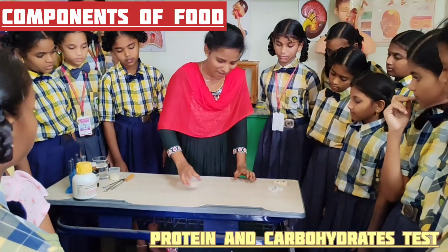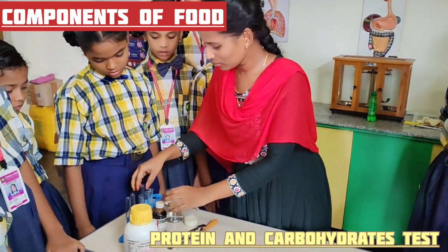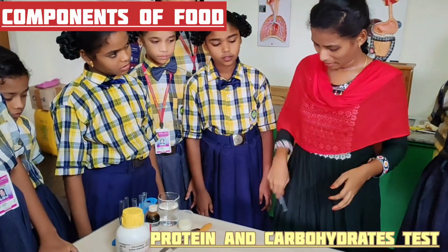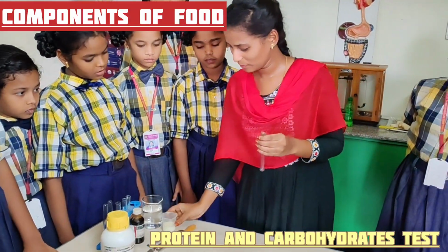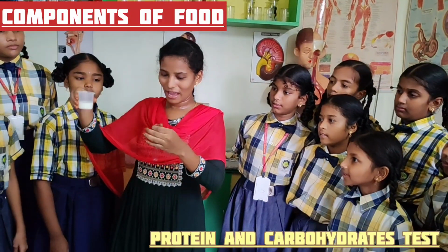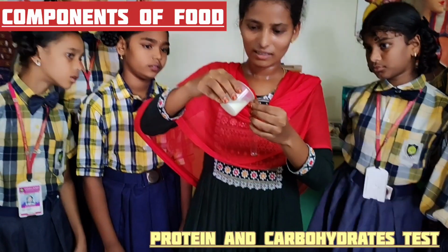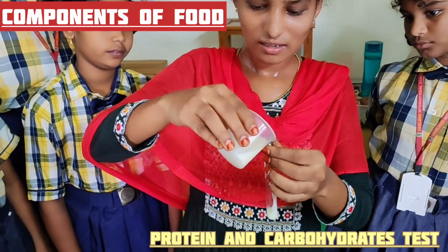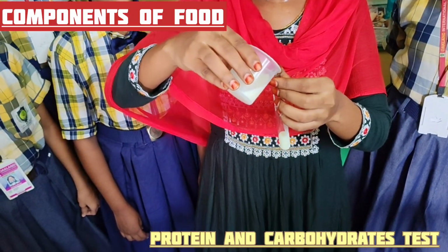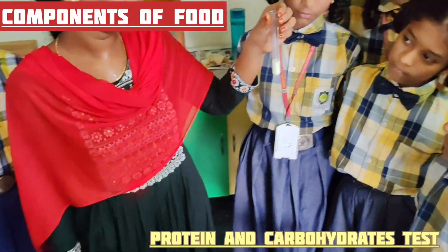Keep aside. Now we will test protein detection. We have to take a few ml of milk into a test tube. This is raw milk. I took raw milk. I am adding this milk. I am taking milk into the test tube. Okay. Few ml of milk I have taken in the test tube.